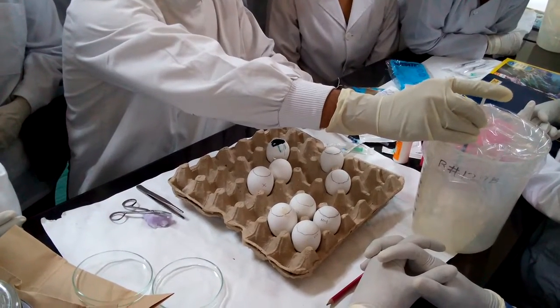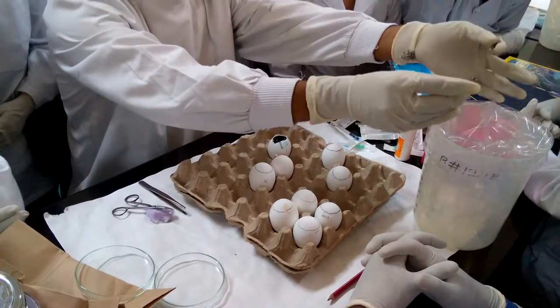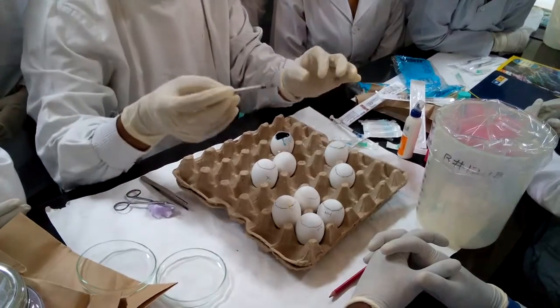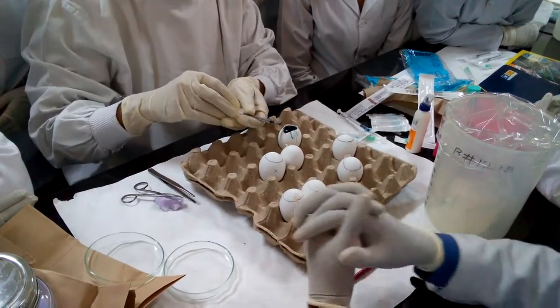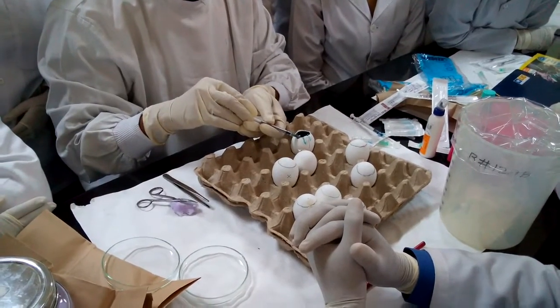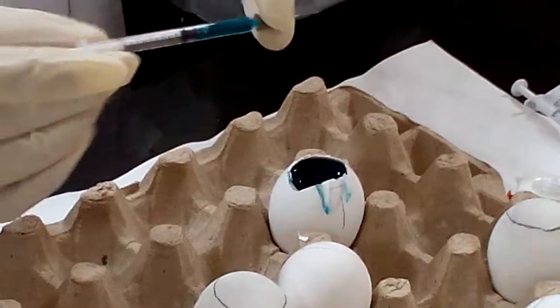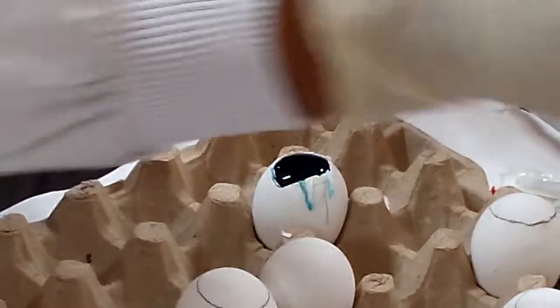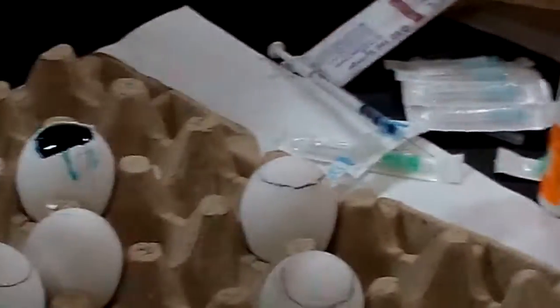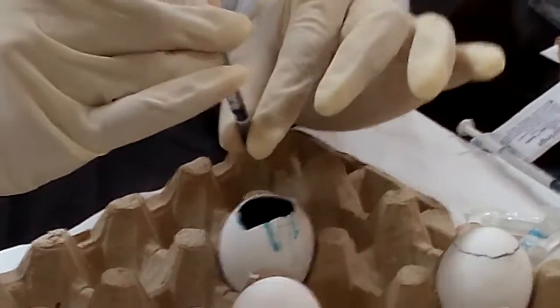I will never do this because this generates lots of aerosols. Even while harvesting, what we do is we don't harvest with this — nowadays we have micropipettes. You take the fluid and when you push into the tube, then remove this and inoculate, because otherwise this will generate lots of aerosols. As you know, influenza spreads by aerosols.